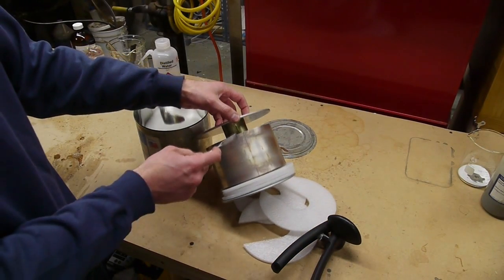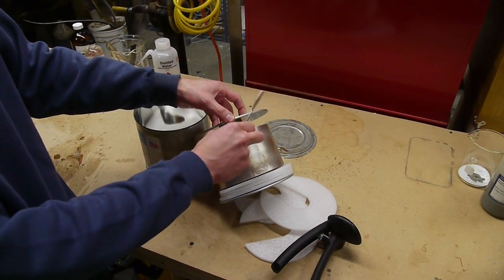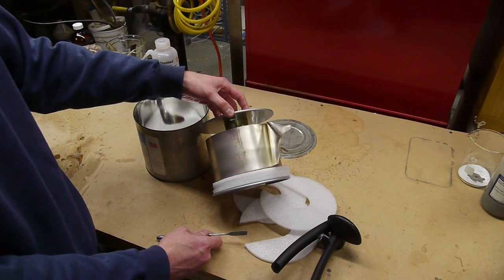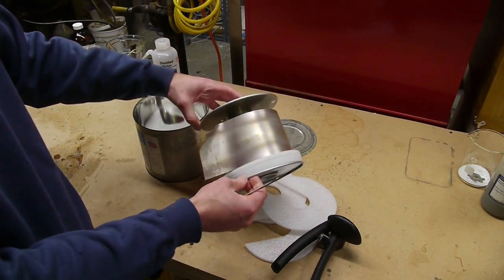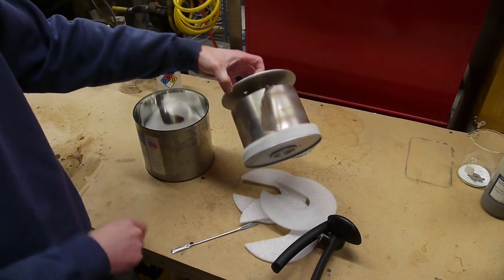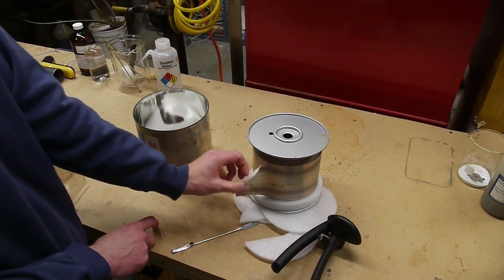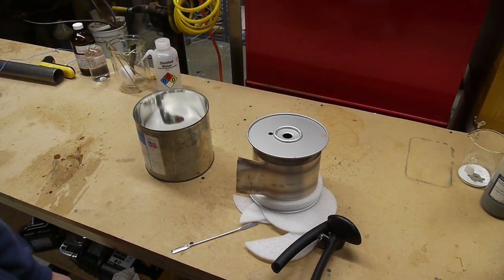So surprisingly, the lithium is actually just here, it's a very thin metal foil. I was actually expecting another container inside here that would allow me to reseal it. So anyway, let's cut off a piece of this and put it in water.